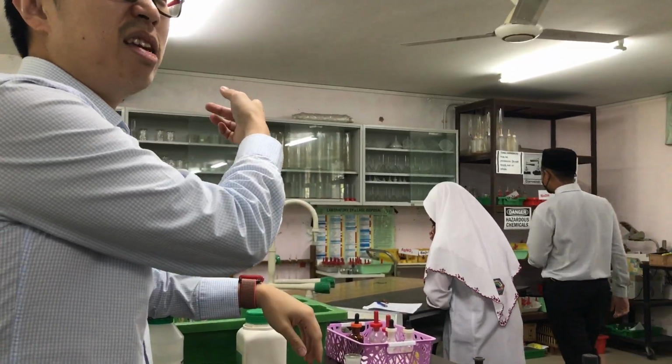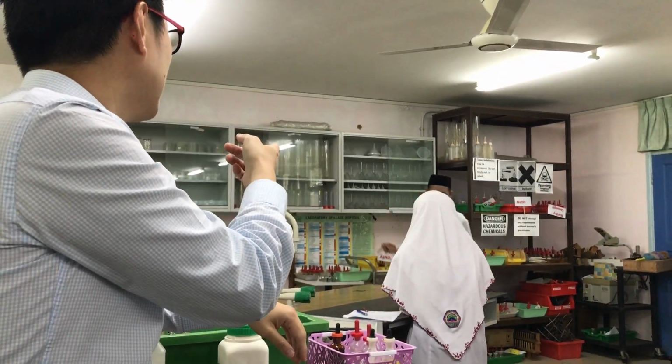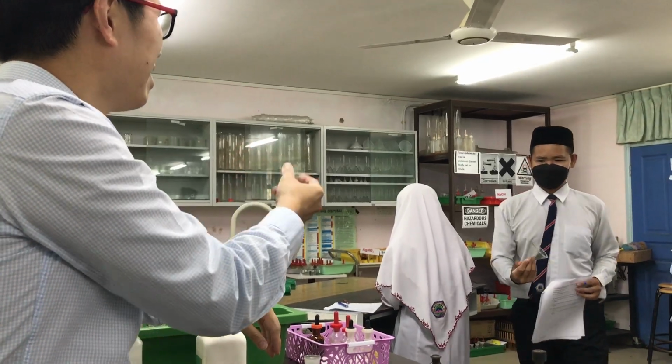What is that apparatus that he picked up called? Filter funnel. It's an English word, funnel.